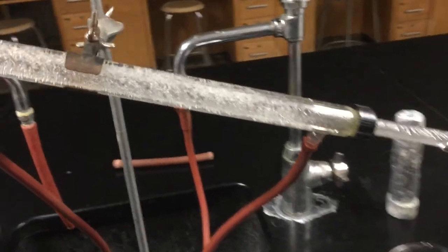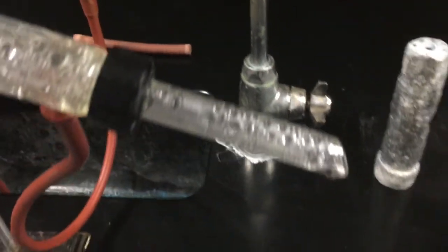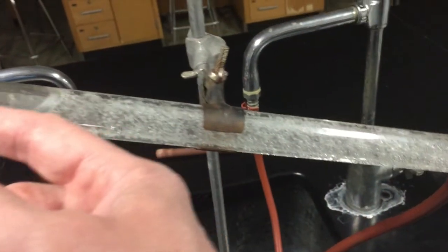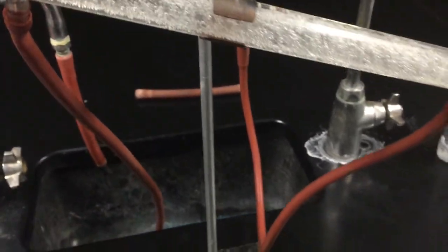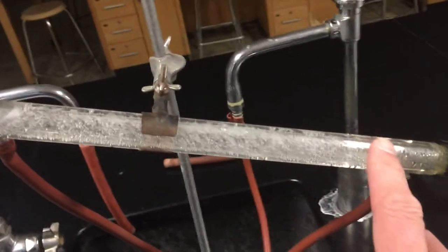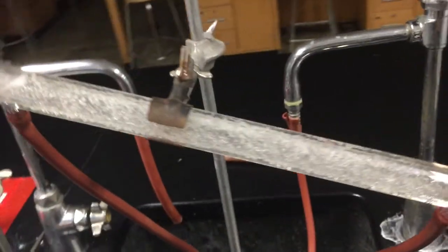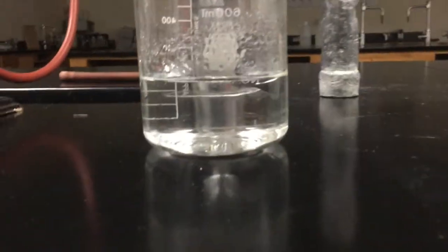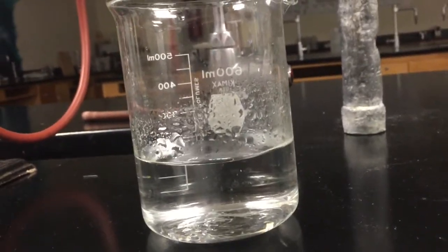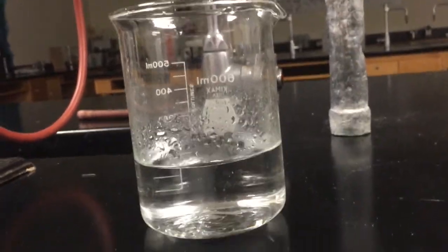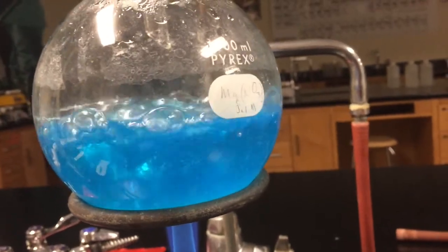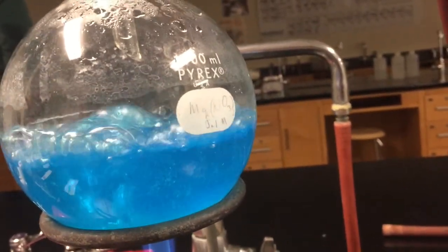Now, this condensing tube, you will see, is connected to a cold water spigot here. And I have cold water coming into the bottom of the condensing tube and moving upwards. And now it's draining out of this other tube into my sink. Now, when I do that, that will cool the steam, not all of it you'll see, as it moves through my condensing tube and recondense the water. And we can see it dripping into a beaker. And you can see the water that I've collected is now crystal clear. It's no longer a solution. It's now just water, the compound H2O. And I've effectively separated the water from my copper sulfate due to differences in boiling points. So if they have different boiling points, I can separate them by something called distillation.